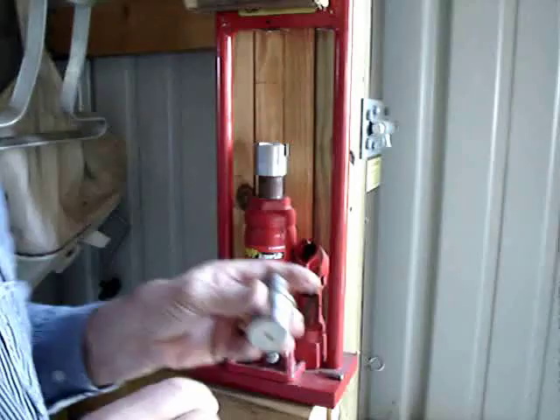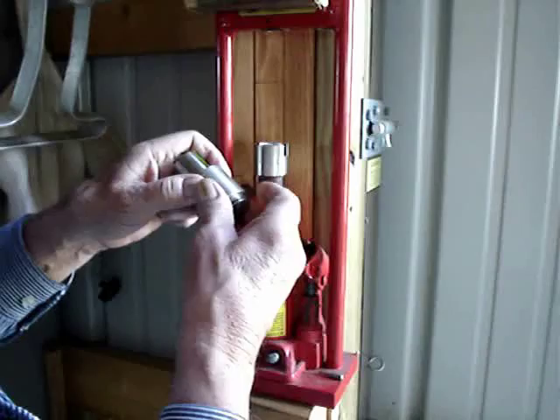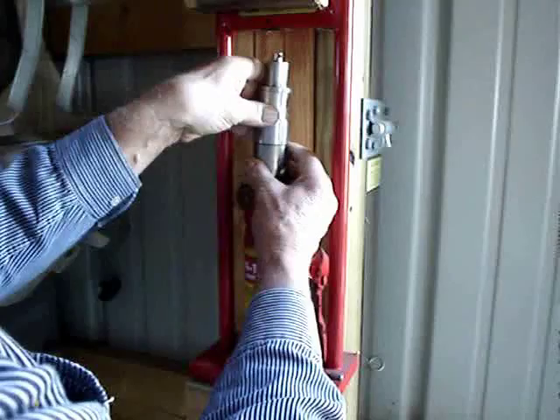Now that little o-ring keeps that from leaking by, and we've got a fitting here — a snap ring fitting that goes on this part — that will keep the first piston going down. Before the second piston goes down, we'll remove it so the second piston can then go down.